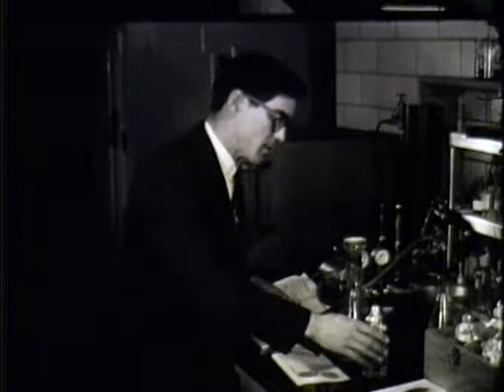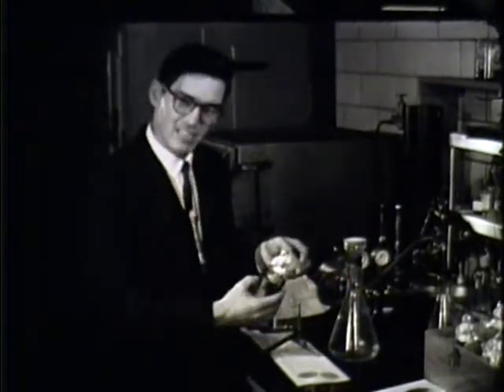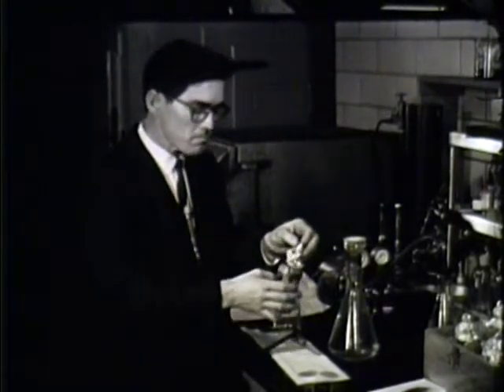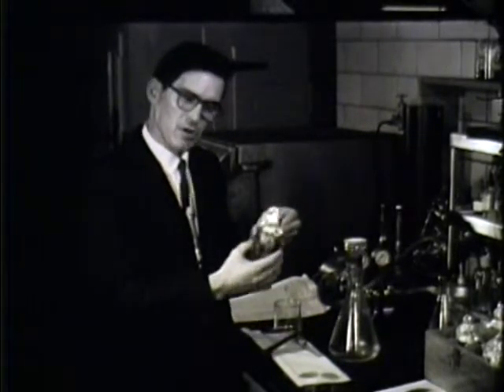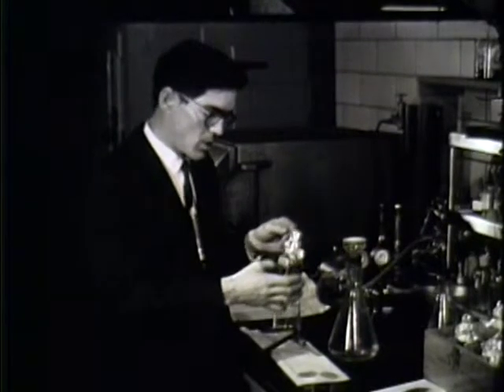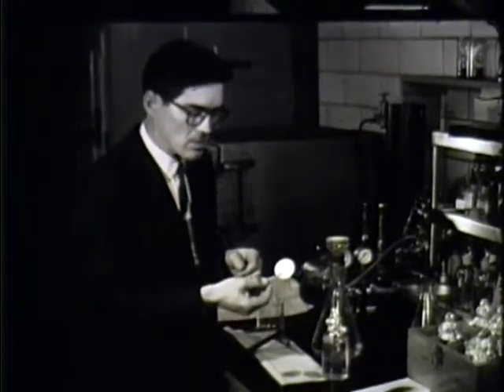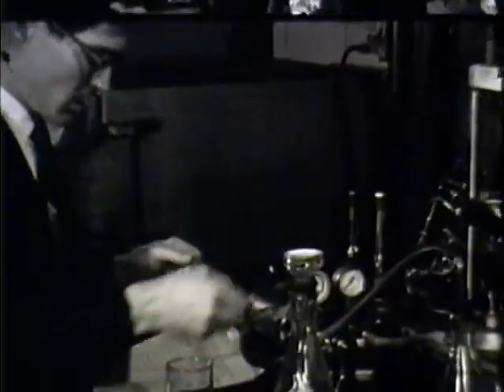Perhaps you'll recall that in the field, some of the samples were simply collected and no particular manipulation was involved in the field. I have here one of these samples. The only particular thing about these samples is that they were taken under very sterile conditions. Nothing was done to contaminate them. Once back in the lab, they are filtered. This small disc is a very fine pored plastic filter. Place this here.